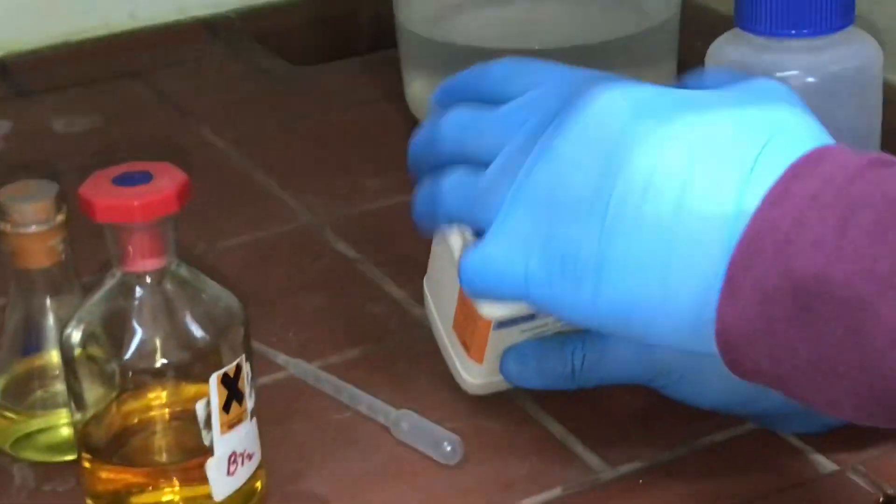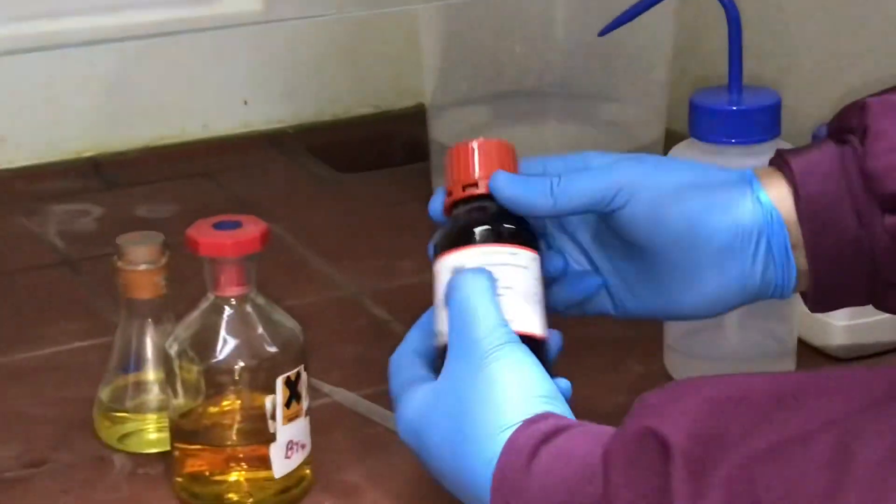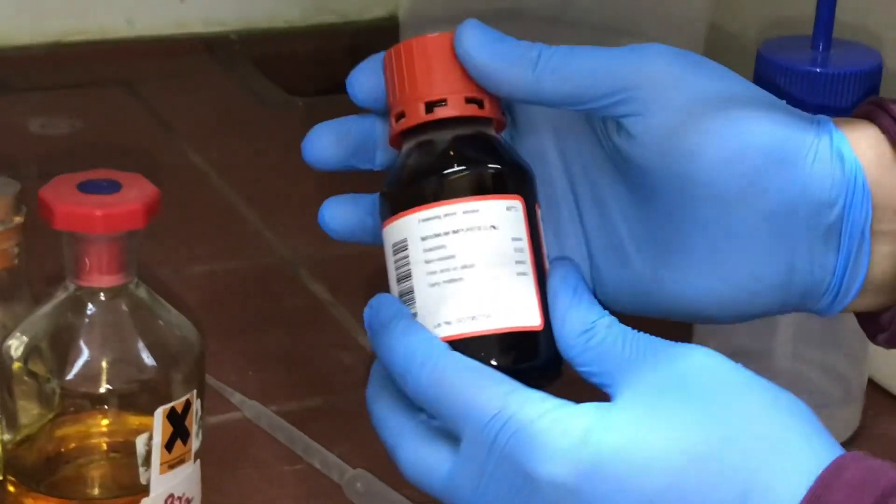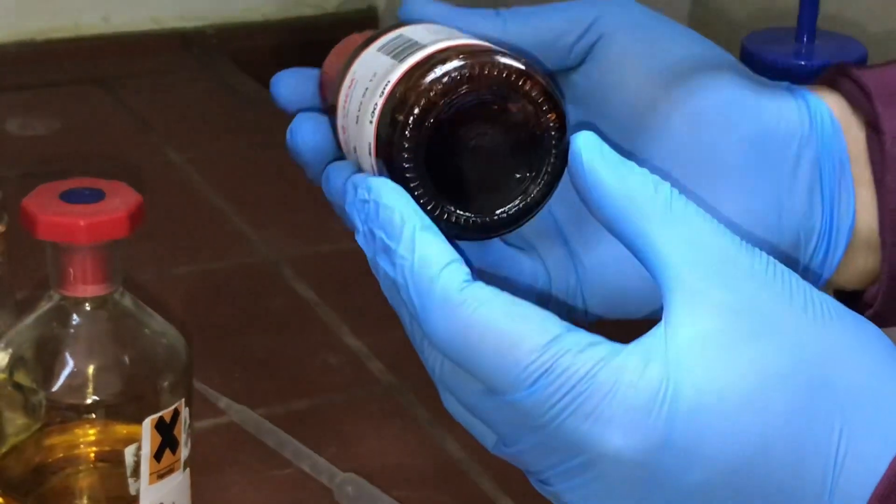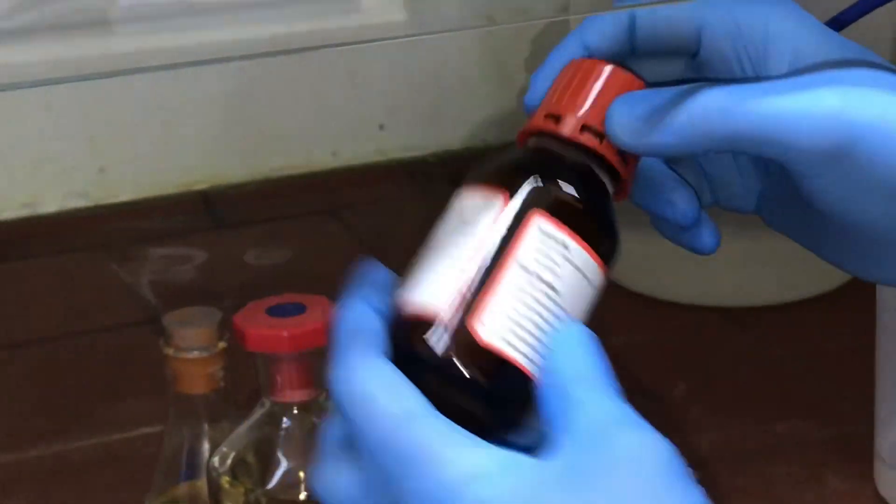If there's lots of water available over a long period of time, the phenol will actually turn into a liquid. There are crystals at the bottom of this bottle and also a liquid. I'm going to show you some of that liquid, so I'm just going to take some out.